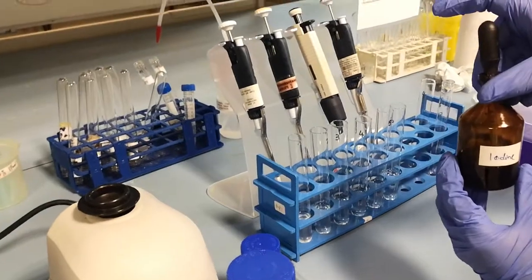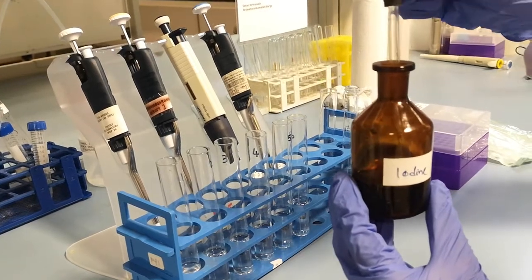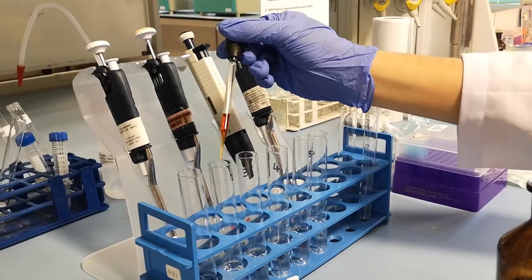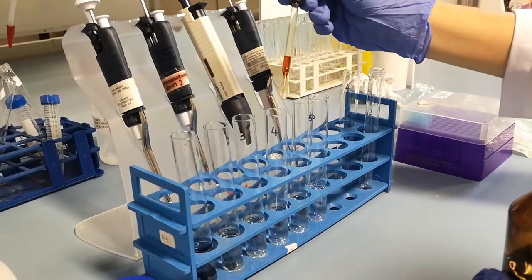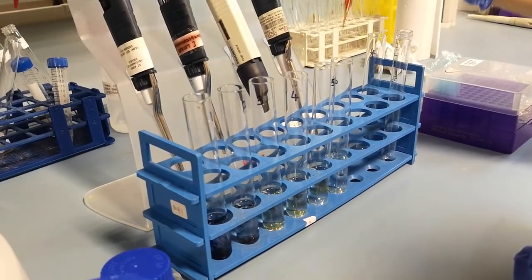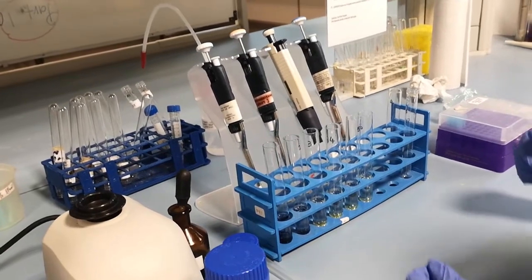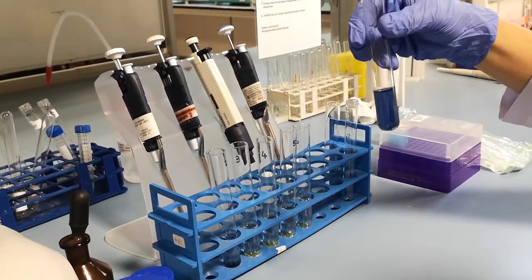Add a drop of iodine solution to all test tubes and record your observations.